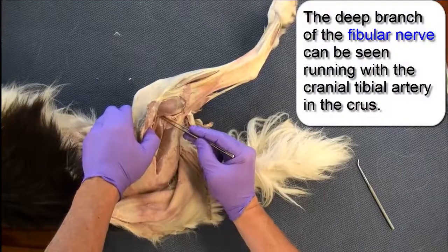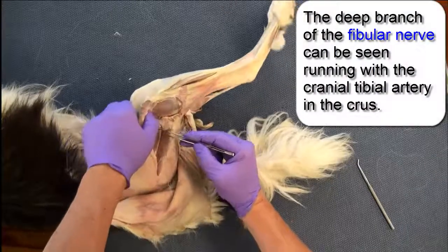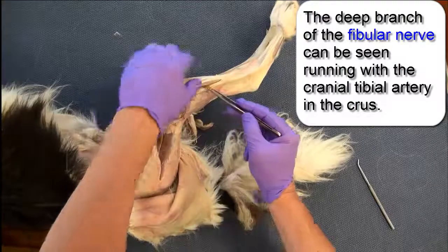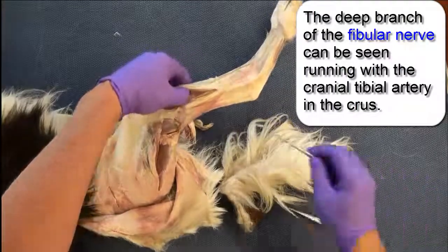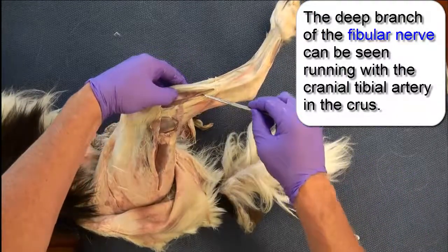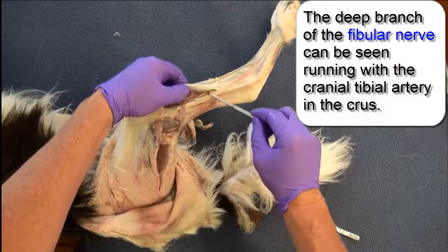The deep branch of the fibular nerve can be seen running with the cranial tibial artery in the crus when viewed from a lateral approach, deep to the cranial tibial and long digital extensor muscles. It runs with the cranial tibial artery.